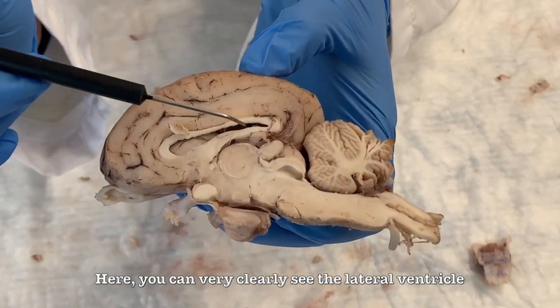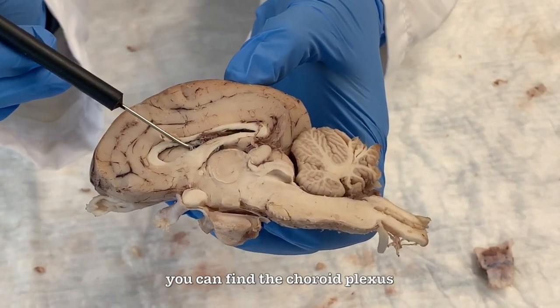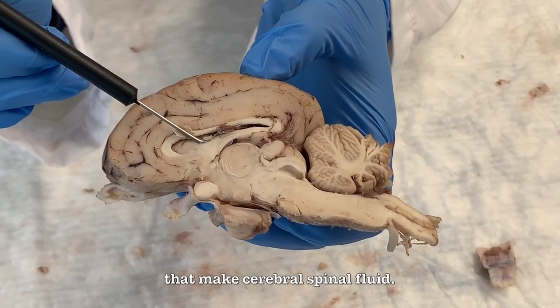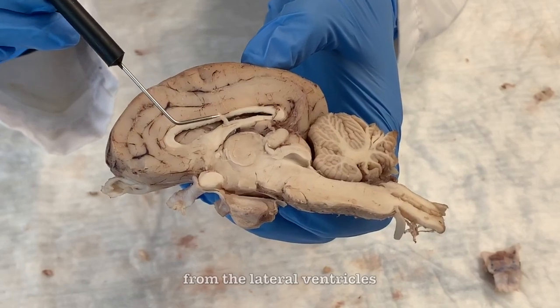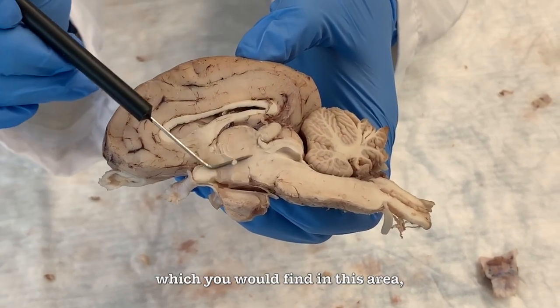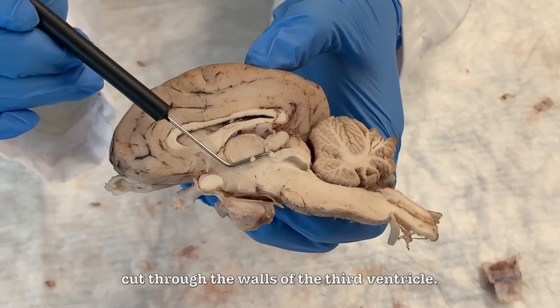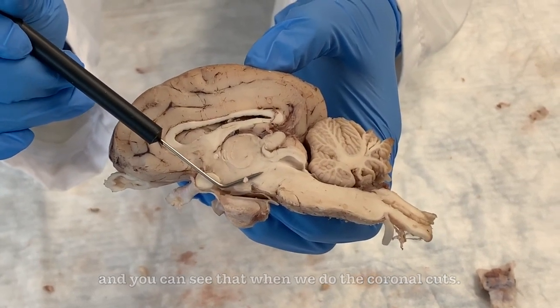Here, you can very clearly see the lateral ventricles, and inside the lateral ventricles, you can find the choroid plexus, which are the specialized cells that make cerebrospinal fluid. The cerebrospinal fluid flows from the lateral ventricles into the third ventricle, which you would find in this area, but you can't see it from this cut because the sagittal cut cuts through the wall of the third ventricle. So it will be here, and you can see that when we do the coronal cuts.